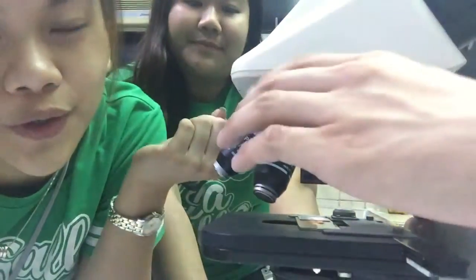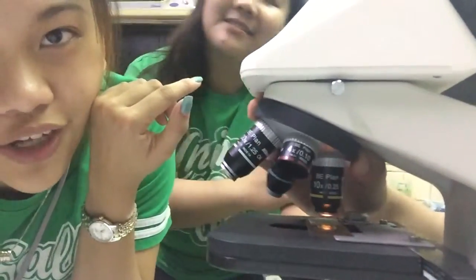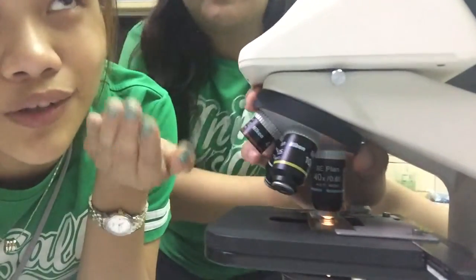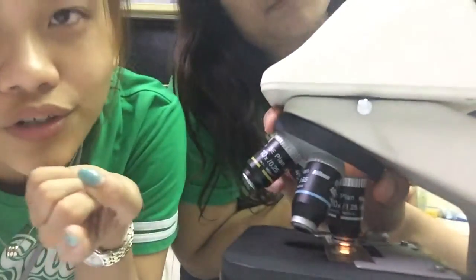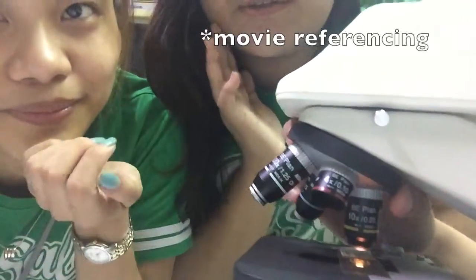As you view the specimen and you switch from low to high magnifications, you focus on one portion of the specimen closely. The closer you look, the less you see. Thank you to our friend Matt here for showing us how to use the microscope and its parts. Now you know.